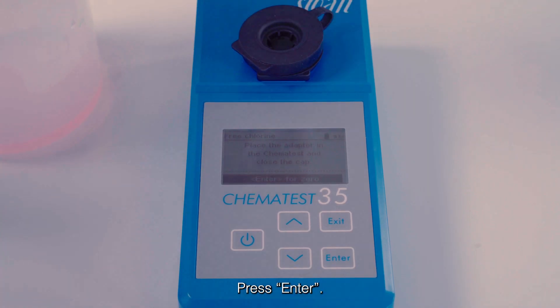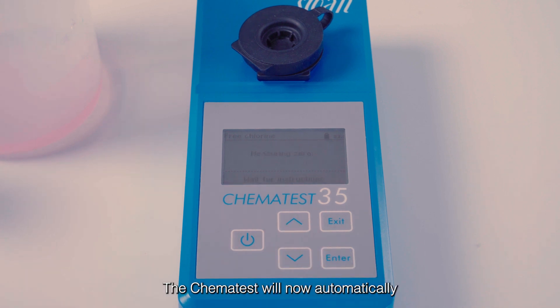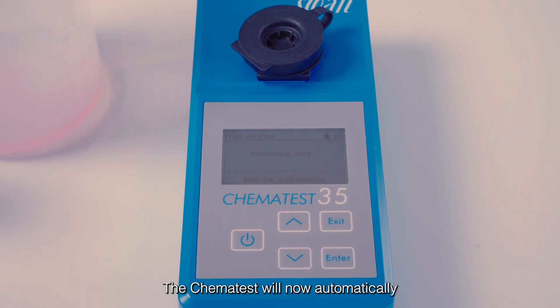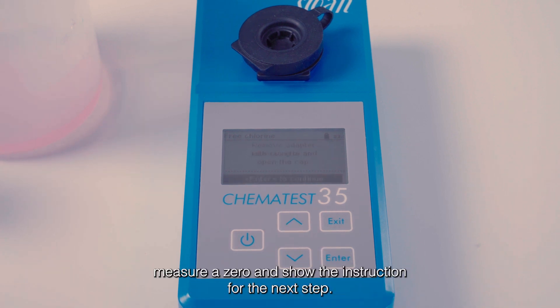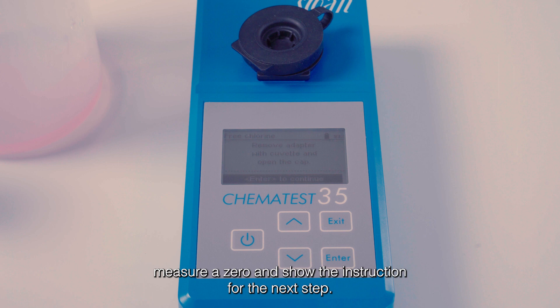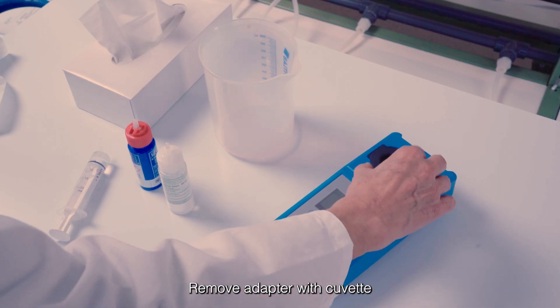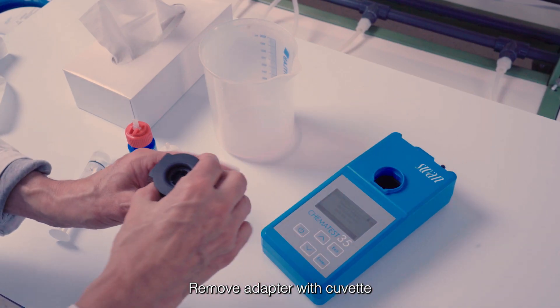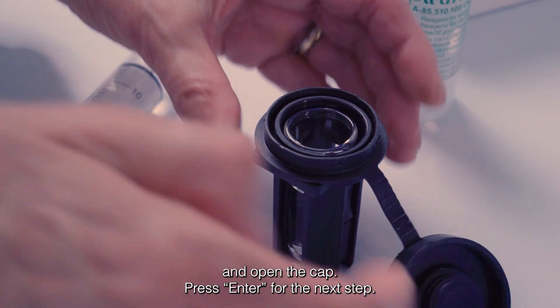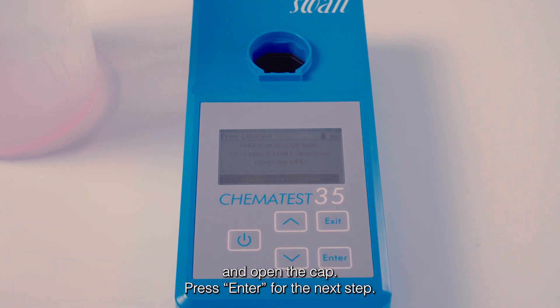Press Enter. The chematest will now automatically measure a zero and show the instruction for the next step. Remove the adapter with cuvette and open the cap. Press Enter for the next step.